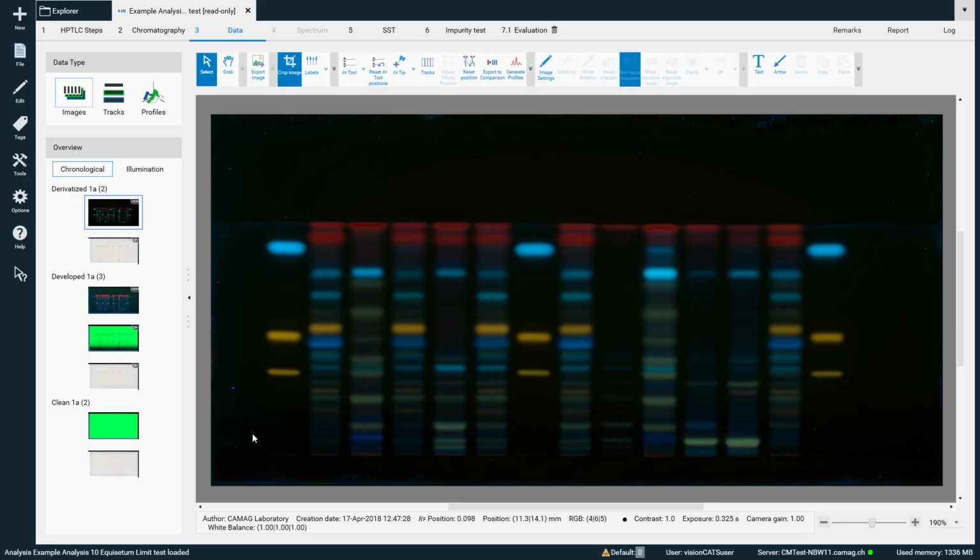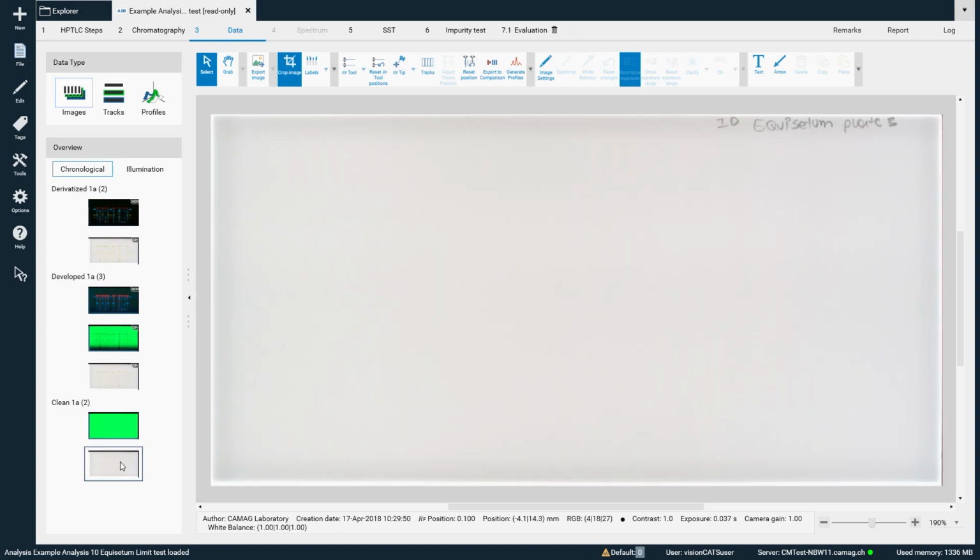Before chromatography, each plate exhibits an inherent background signal due to the stationary phase and plate structure. By subtracting the clean plate image, visionCATS reduces background interference and produces a clearer image, enhancing the visibility and definition of sample zones. It is essential that the plate is positioned identically in both images.